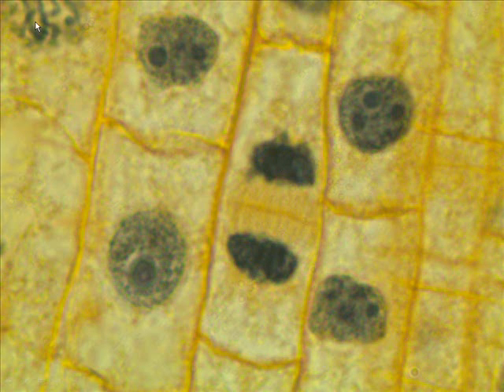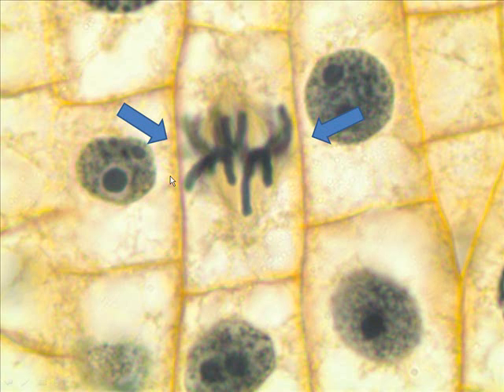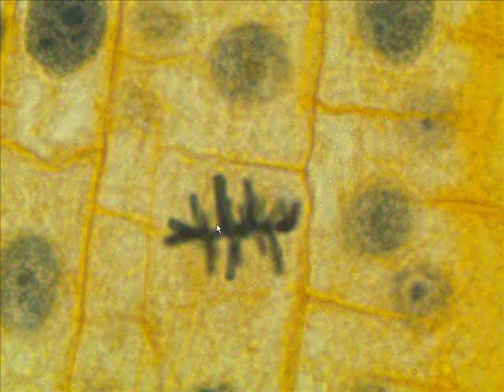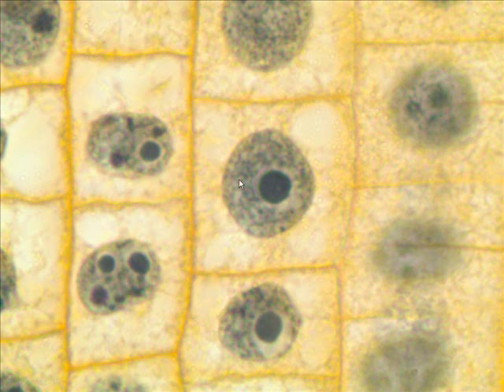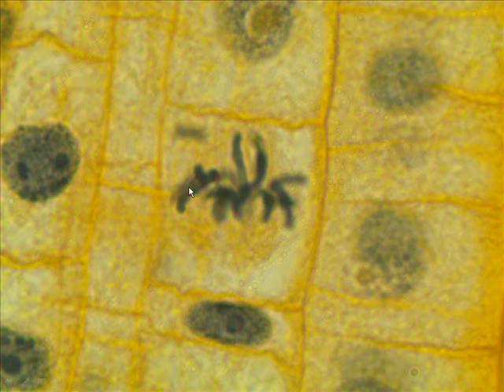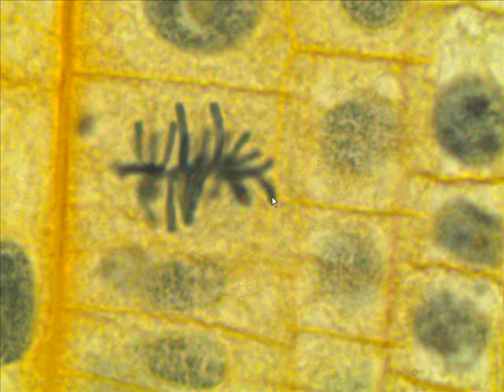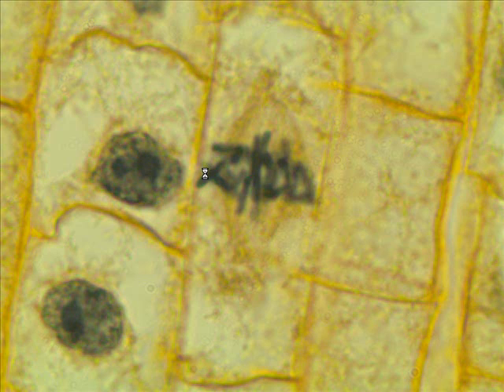This one up in the upper left corner? Prophase. Metaphase. Anaphase. Metaphase. All four of these? Interphase. Metaphase. Prophase. Metaphase.